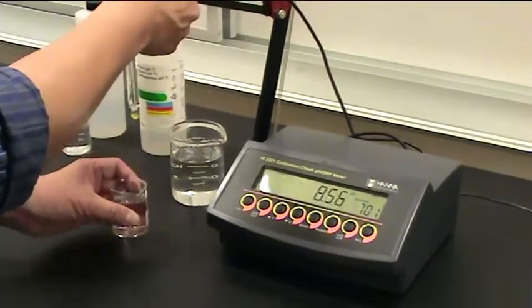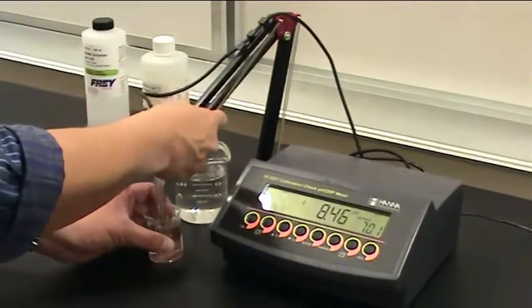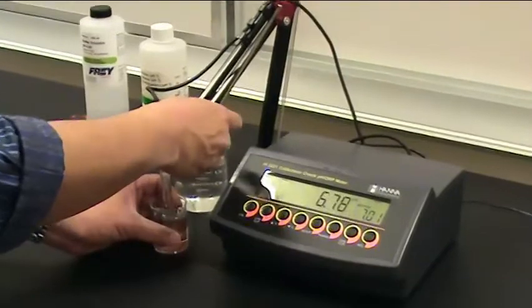Buffer 7 is the first one that it would like, so make sure you take pH 7 buffer and immerse the probe far enough so that it can get a good reading.